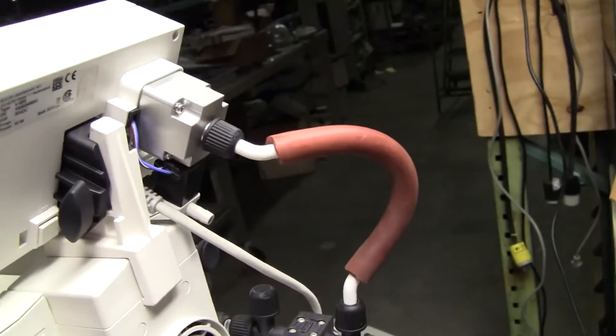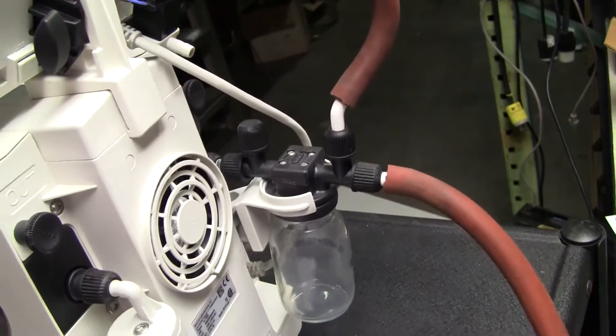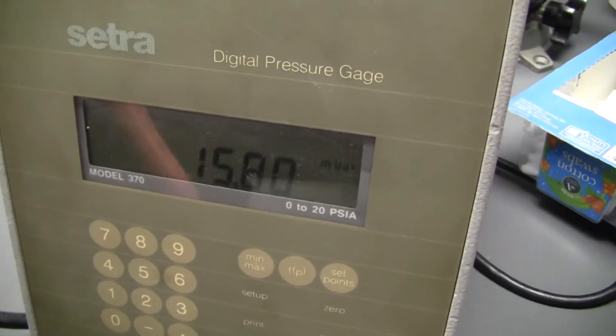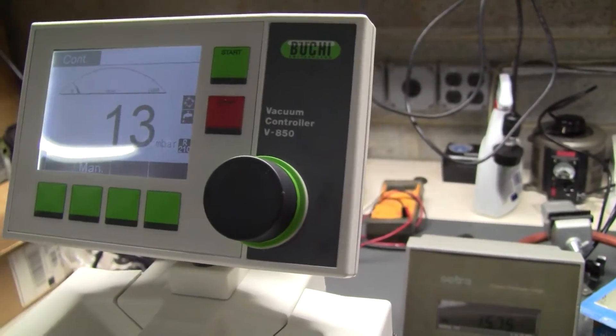A quick little loop set up in the back. We have hooked up our external monitor which is now rating at 15.7, 2.8. Close enough as far as calibration.